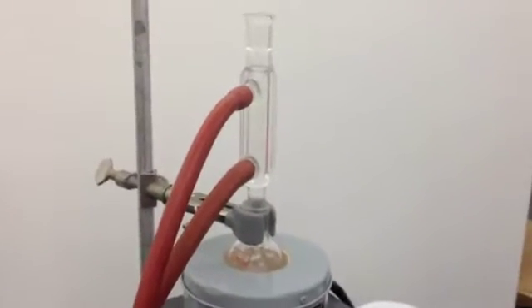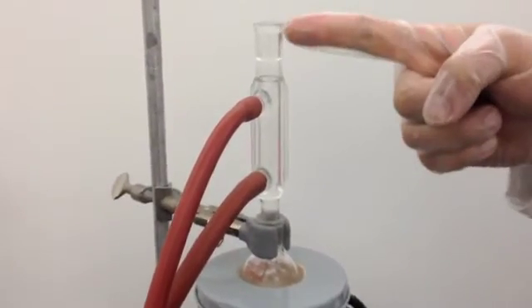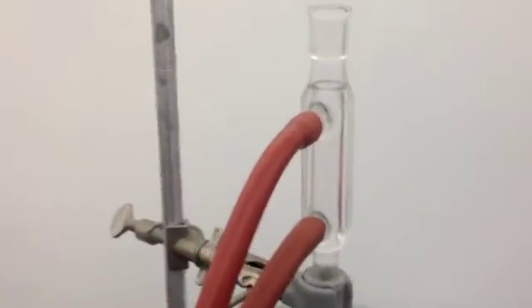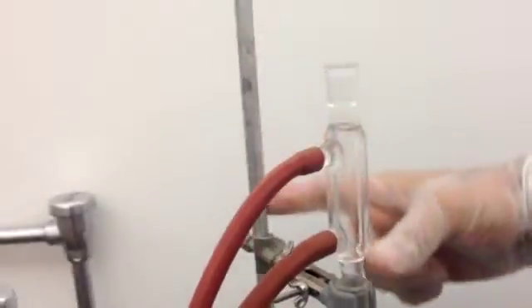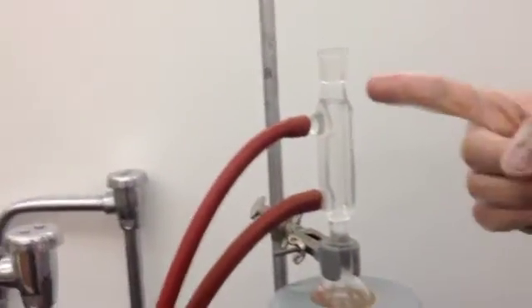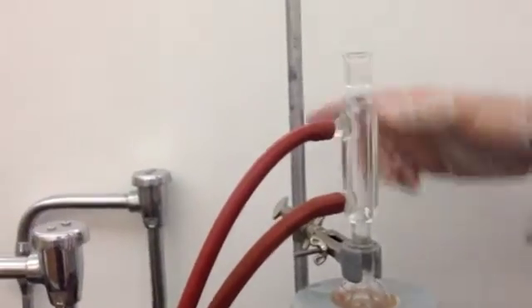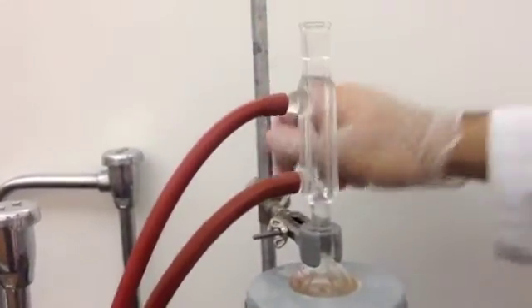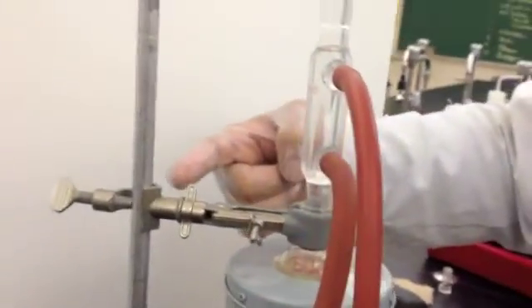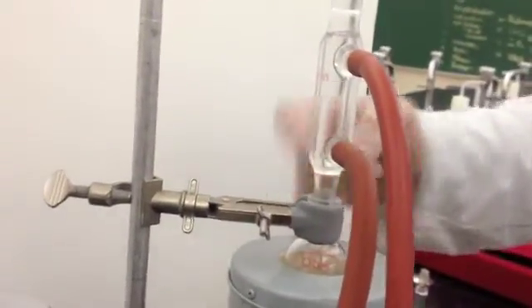Okay, now I would like to enforce a point that your apparatus should be parallel to the bar. And by apparatus, I mean, I do mean the water jacket and condenser. It should be parallel to the bar and it should be perpendicular to the two-finger clamp for better results.